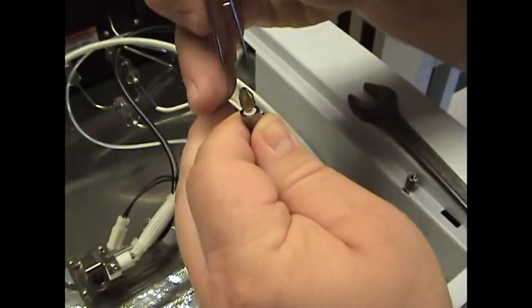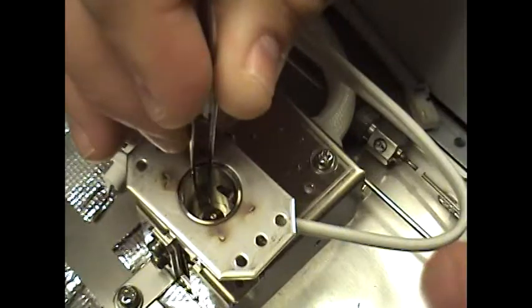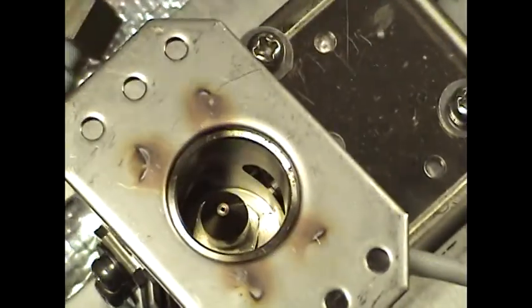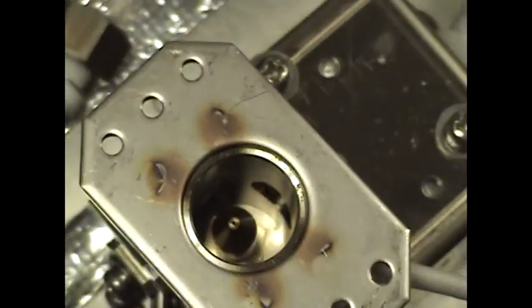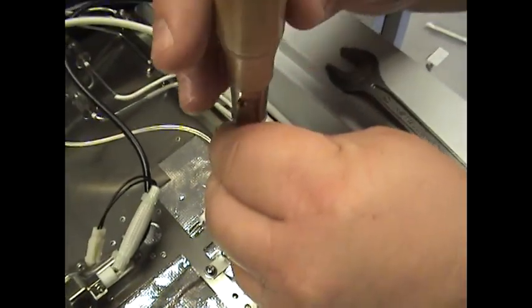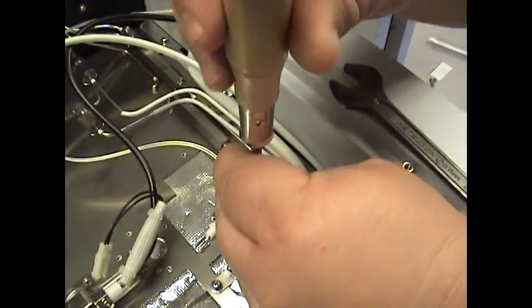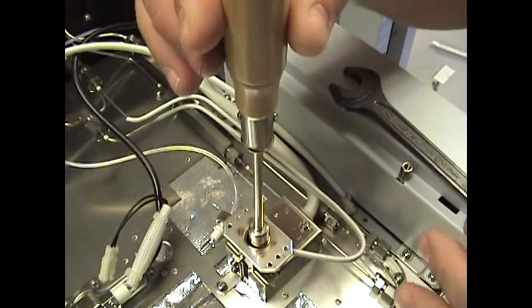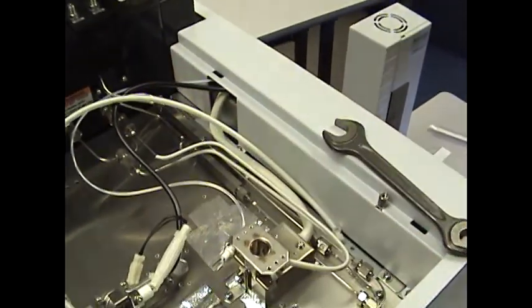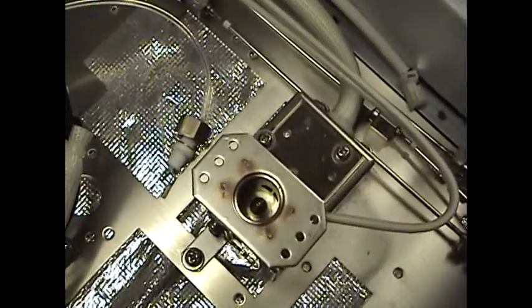Okay, go ahead, grab that pair of forceps, gently place that down, center it up. Take the tool — once again keeping it flush — make sure it's seated, and just begin to turn it gently. It's self-tapping, and once it's tight, you just want finger tight, make sure it's snug. Lift it straight up. That's all there is to inserting the jet.